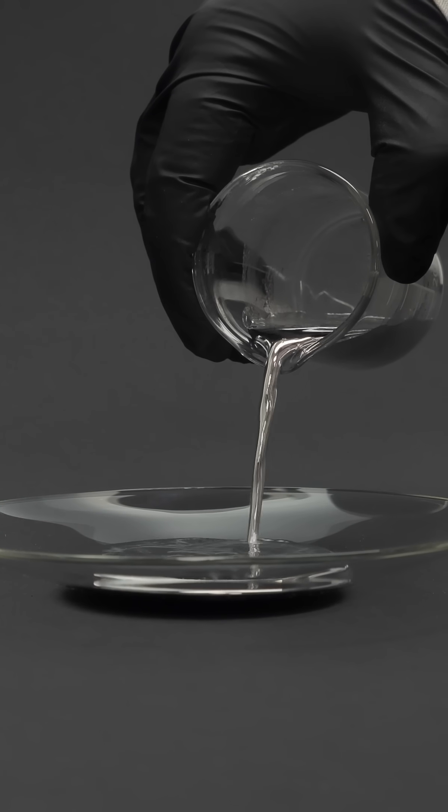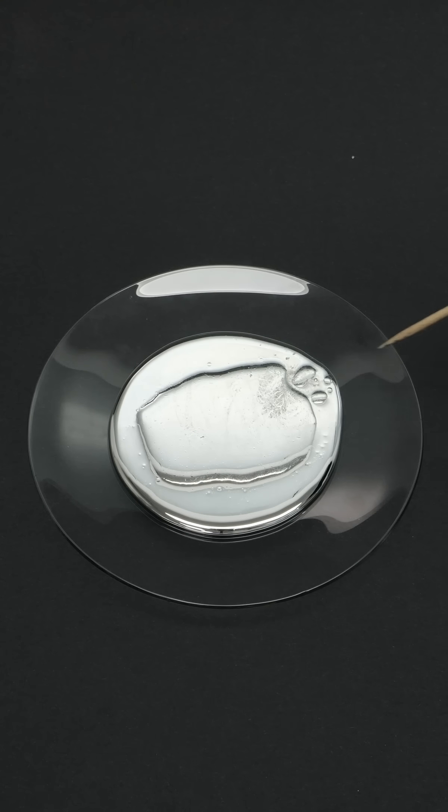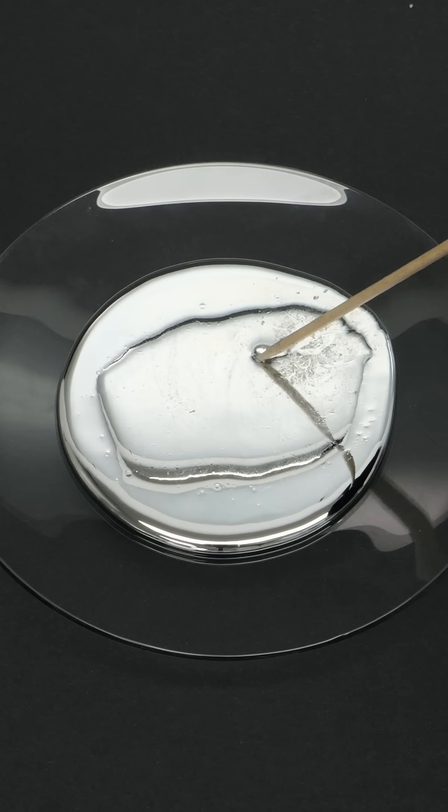Here it's clearly visible that gallium floats on top. This makes perfect sense as mercury is twice as dense, causing the lighter gallium to drift like an iceberg on the surface.